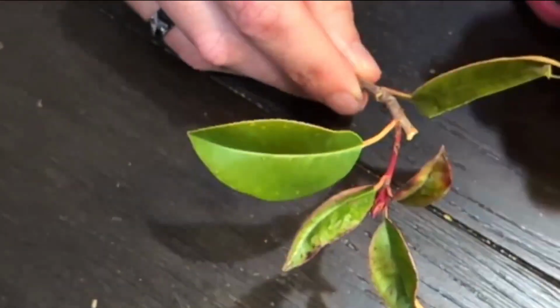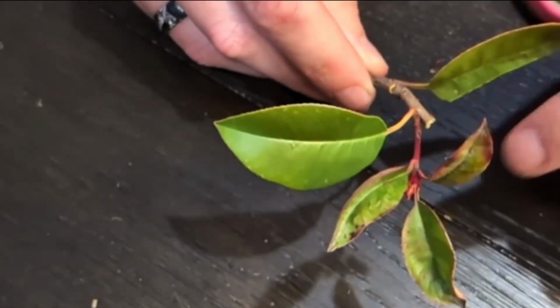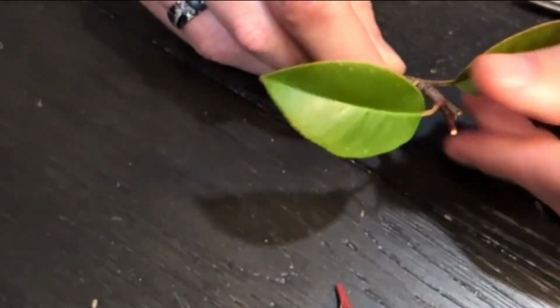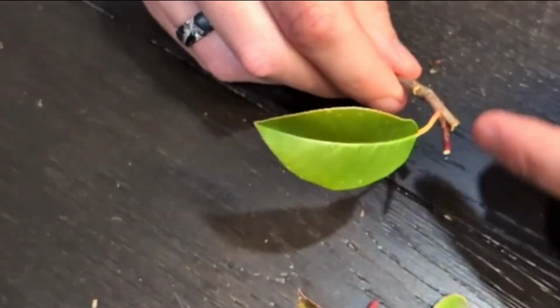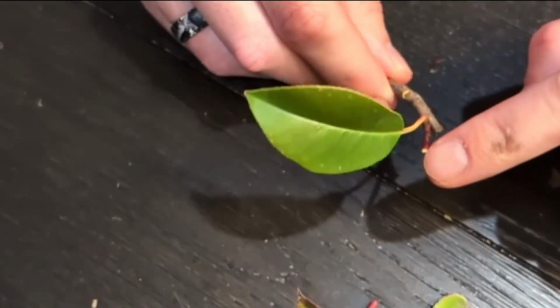Put that one off so you can see a little better. Now, we're going to ignore that because that's a shoot from a different twig. So I'm going to cut that off so it doesn't distract us here. I'm going to rip this leaf off so we can see it better. Now, so here's the stem. Here's the axillary bud that tells us we're dealing with the leaf.